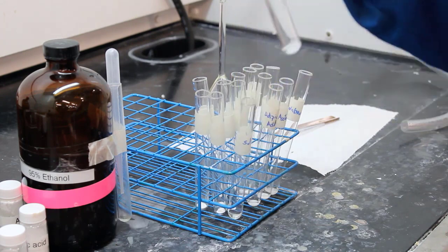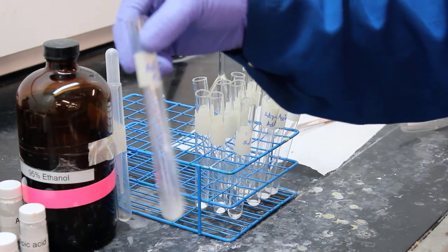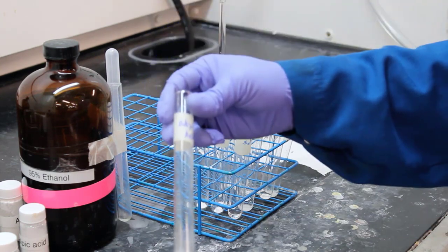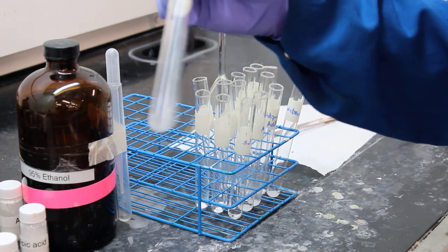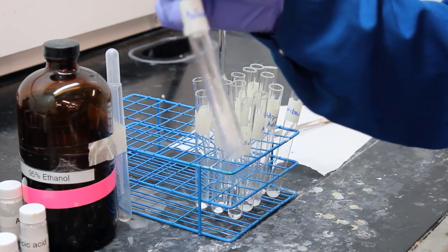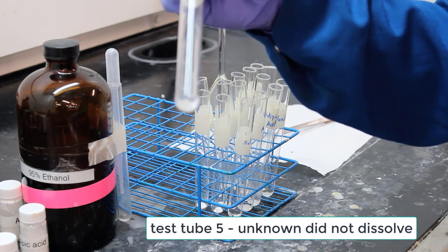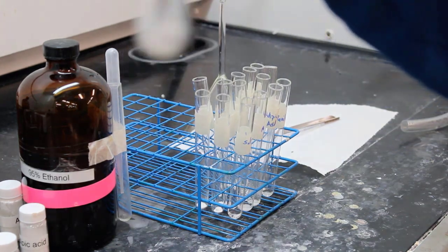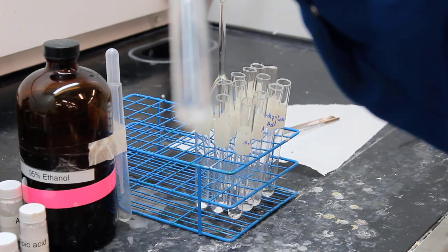All right. So this is considered room temperature. If we look at acetylsalicylic acid, you can see some white powder in there. It's not really dissolving. Adipic acid, same problem. It's not really dissolving in ethanol at room temperature. Acetanilide, not really. Well, hang on, is it? The unknown did not dissolve. So it looks like the only one to really dissolve in ethanol at room temperature was salicylic acid. We have to be specific here.